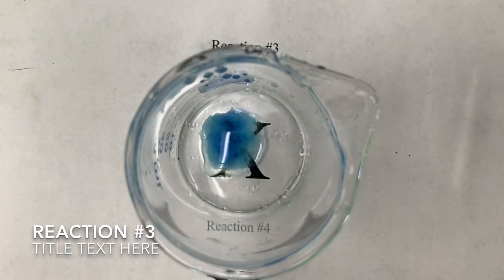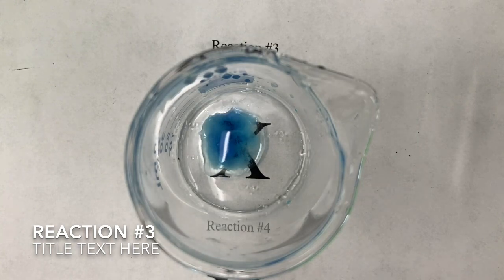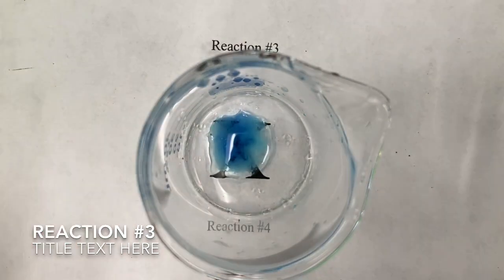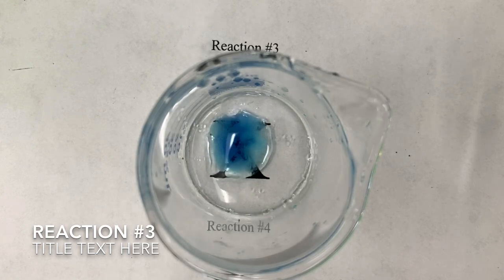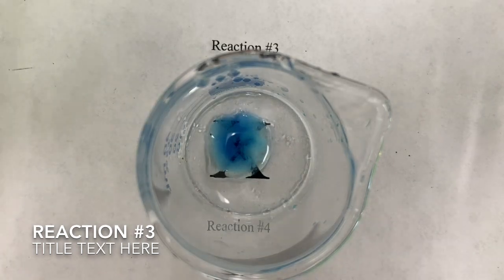Okay, it says when you add lots of NH3, it starts bonding with the copper to form CuNH3. Which way would equilibrium shift if I continue to add NH3? If I continue to add that ammonia. So make your prediction for 3B here. Again, pause the video if you need to. And now I'm going to add additional drops of NH3 until we observe some kind of change. So let's see what happens here.